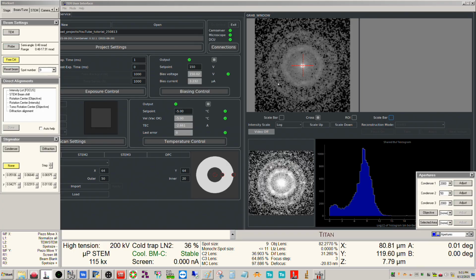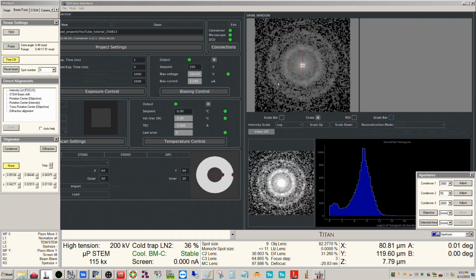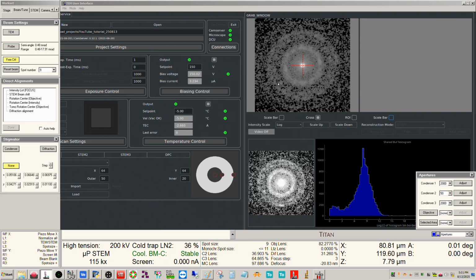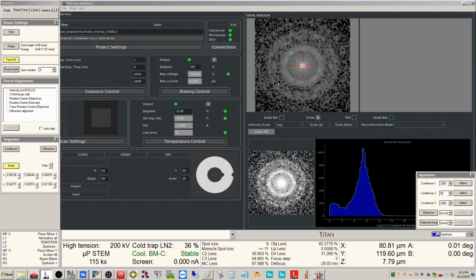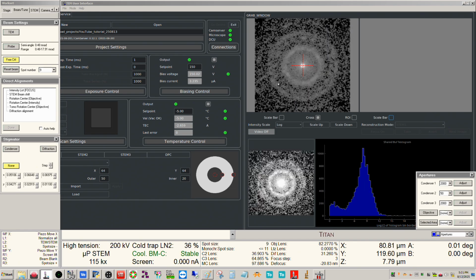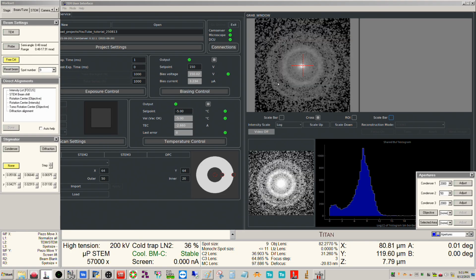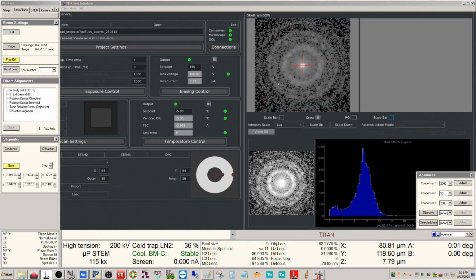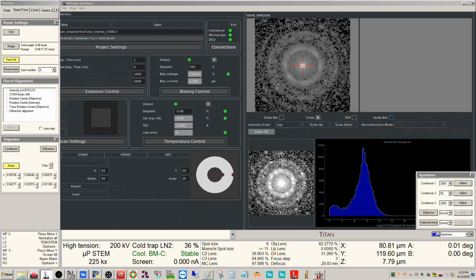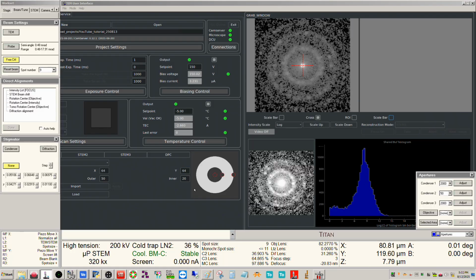So that's the D-scan artifact, and that's a consequence of the fact that we don't quite have the beam tilt pivot points, beam shift pivot points balanced perfectly. There is an alignment you can do for that in microprobe STEM. I find that even after I do that, this still is not corrected anyway. But you can see, as I decrease the mag, it gets worse. As the mag goes up, this effect is less. It's still there at 115K indicated, but not terribly bad. Then at 225 indicated, it's very, very slight. And then at 320K indicated, it's not very evident at all.